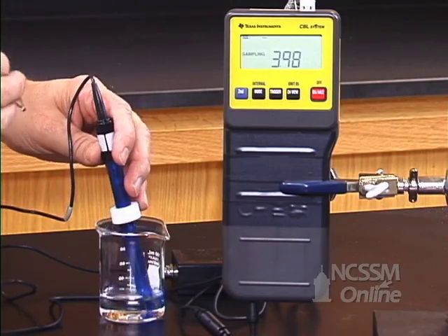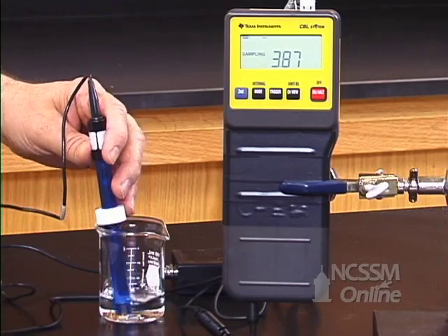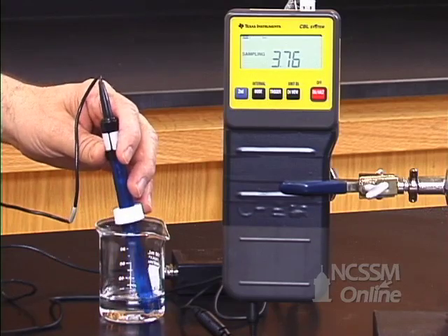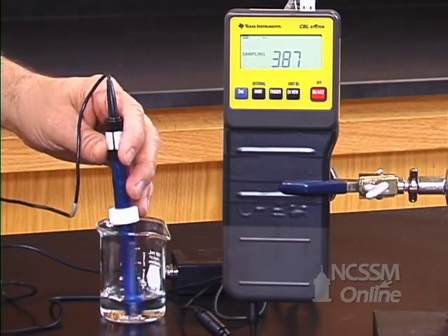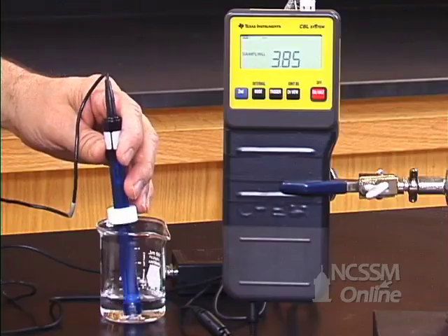After adding 30 drops of one molar HCl, the pH has started to drop rapidly.